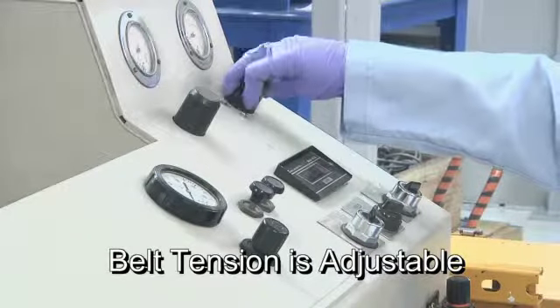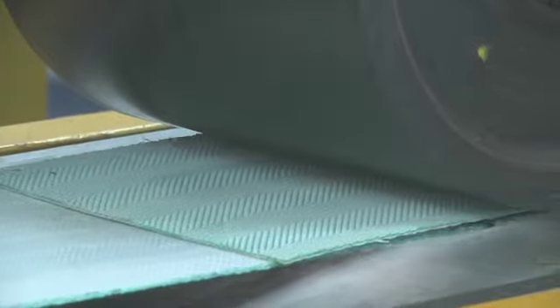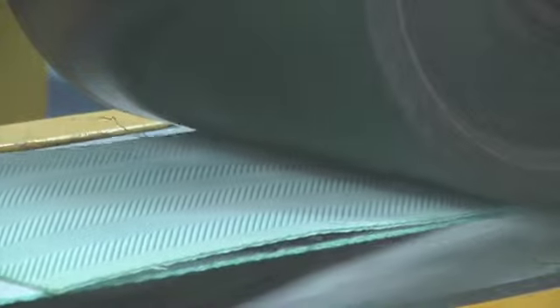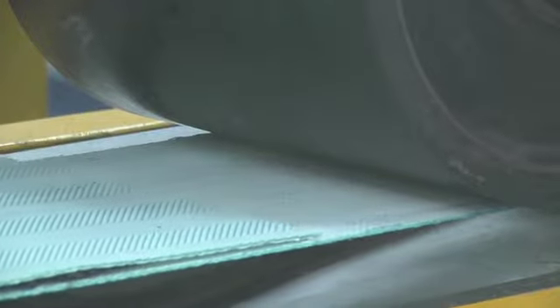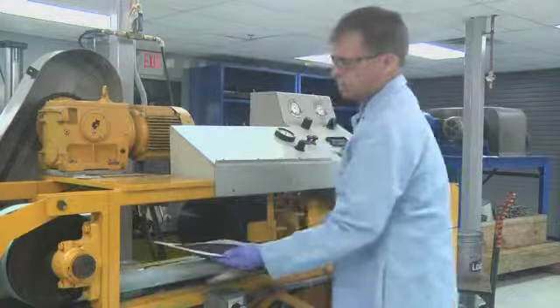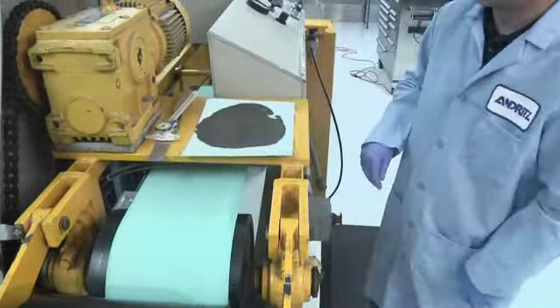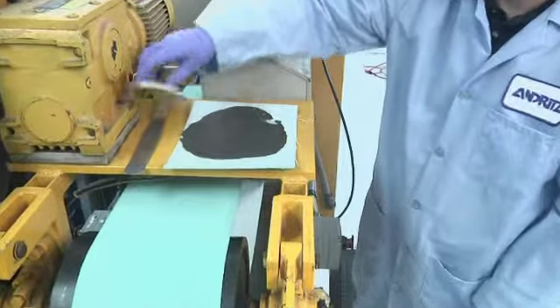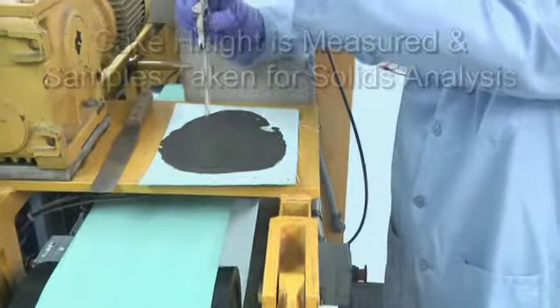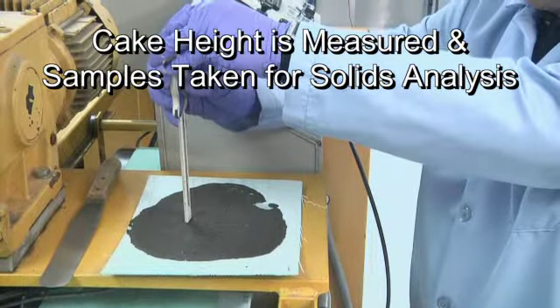The belt speed and belt tension is adjusted during the test to match the belt filter press being simulated. Cake height is measured and samples taken for solids analysis.